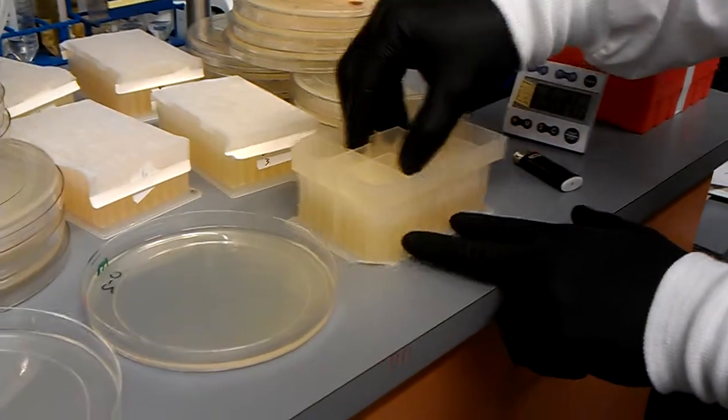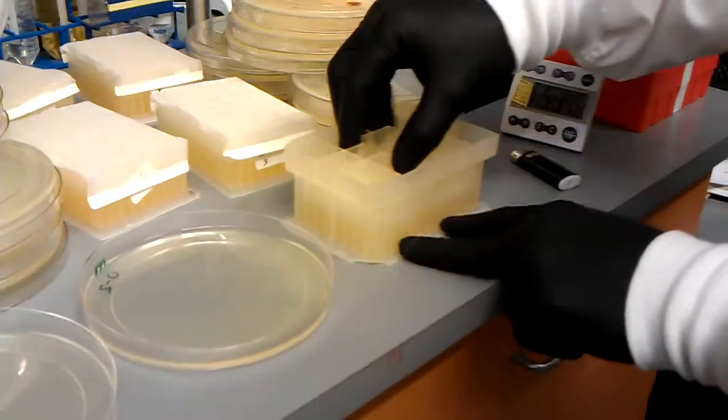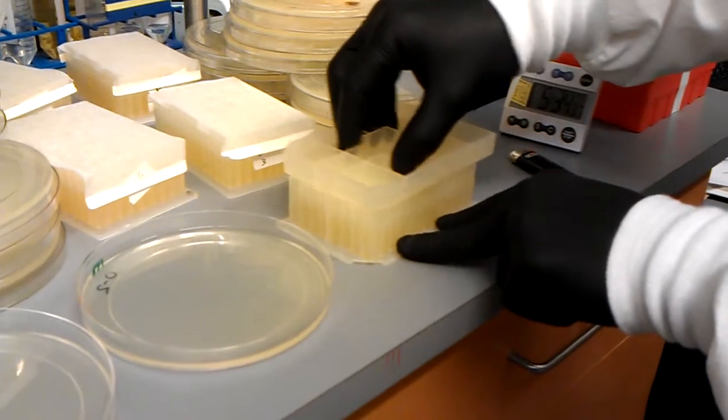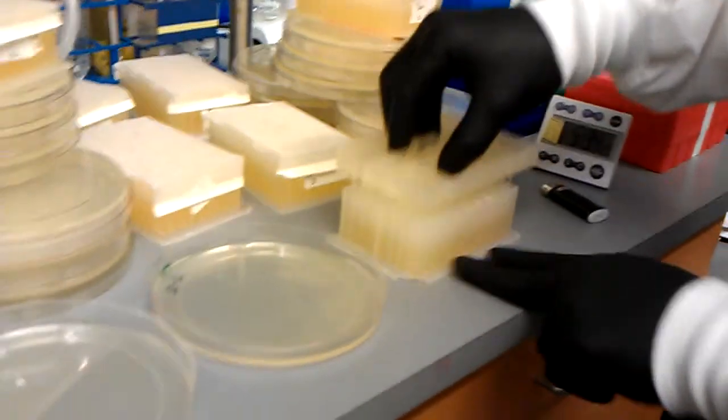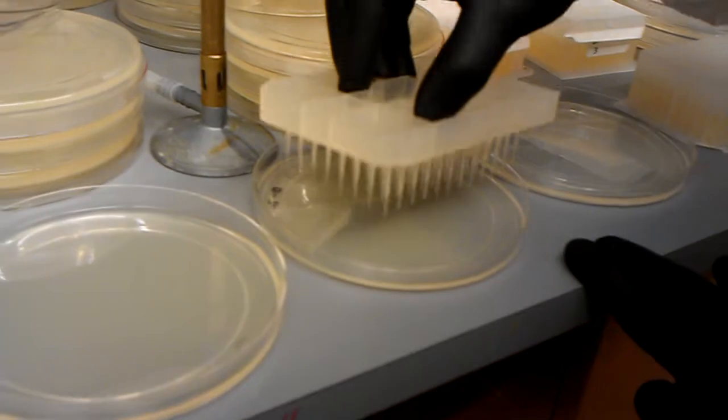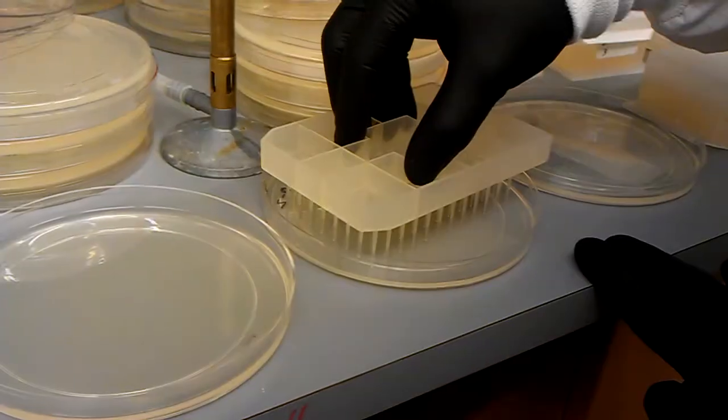I'm just going to stamp out the rest of the plate so I can go right back in. This culture is not going to be saved for anything, so I can contaminate it. And then we go back. A1, touch it.